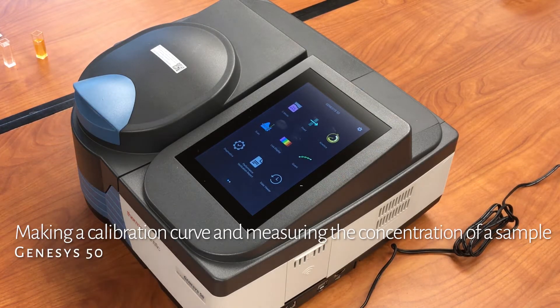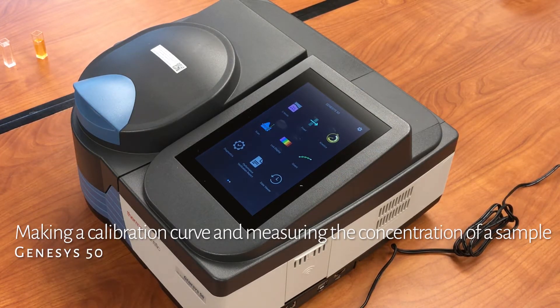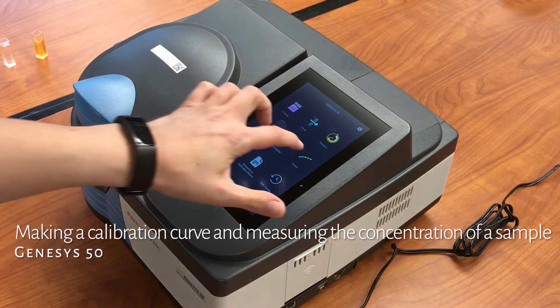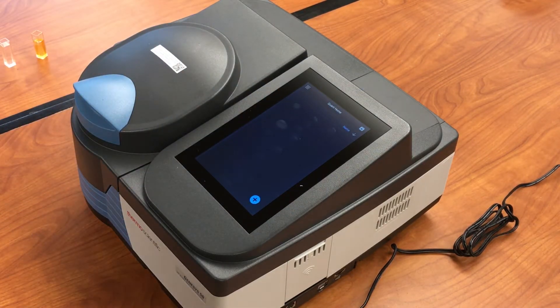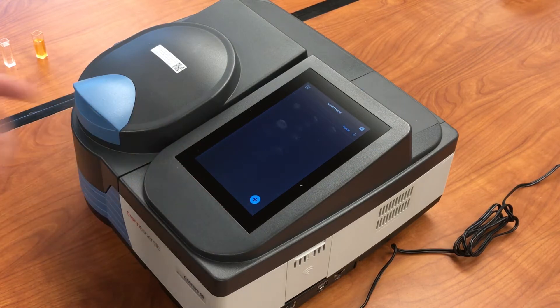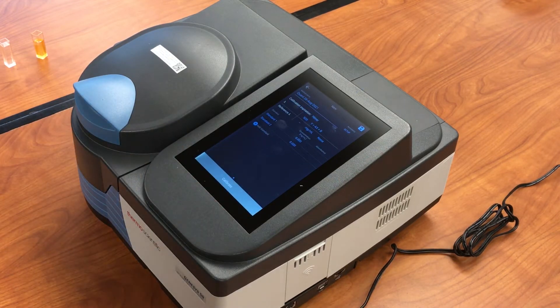To set up a calibration curve, we're going to select Quant from the main menu. We're going to tap the plus sign to set up the method.